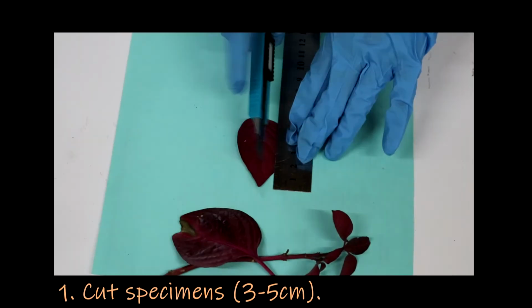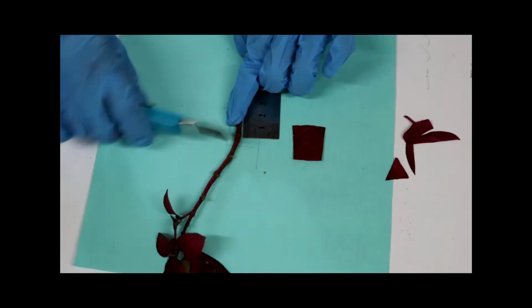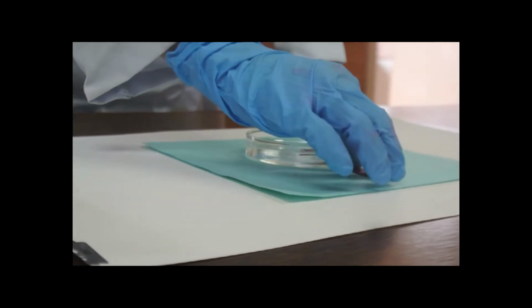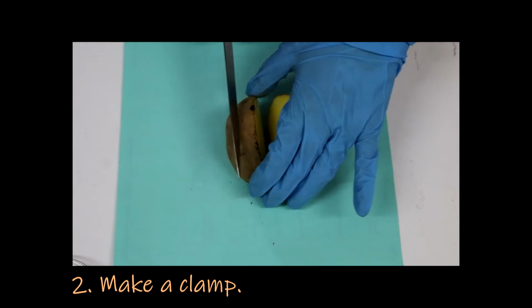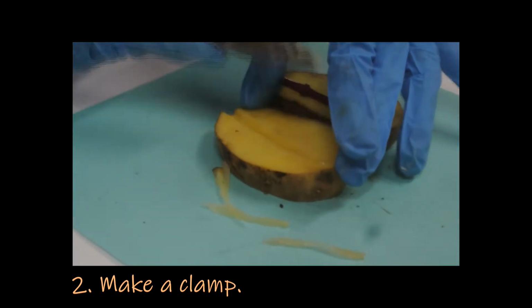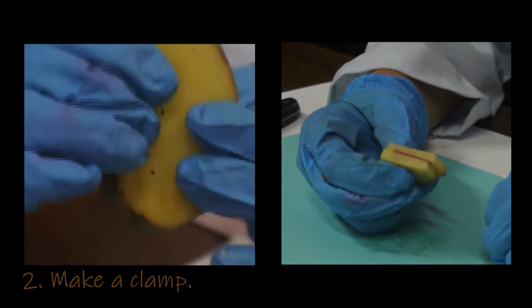First, cut the specimens into small pieces. You'd like to have 3 or 5 centimeters of length for your plant specimen part. Do soak the specimen for sectioning in water to prevent them from drying out. Next, what you would like to do is to get a stable support for your specimen. Do this by taking a radish or potato and cutting them longitudinally in half. Then on the inner surface of one or both halves, make a groove deep enough for your specimen to fit in, and then close the specimen to be sectioned here.